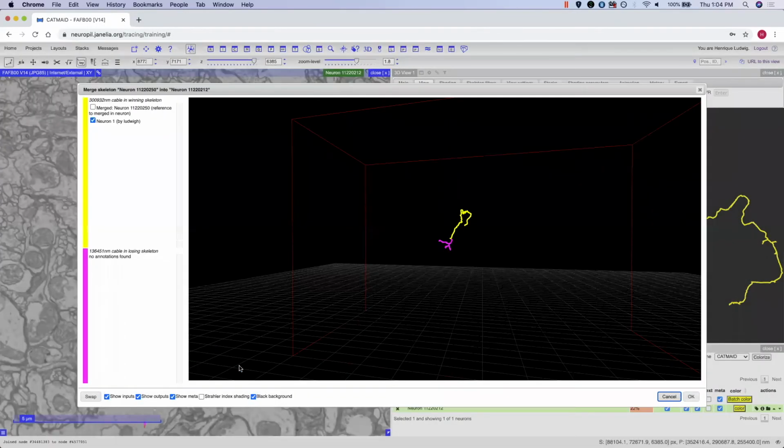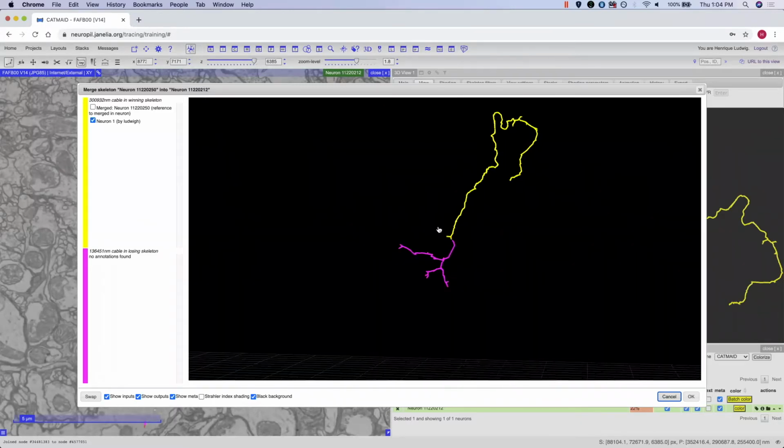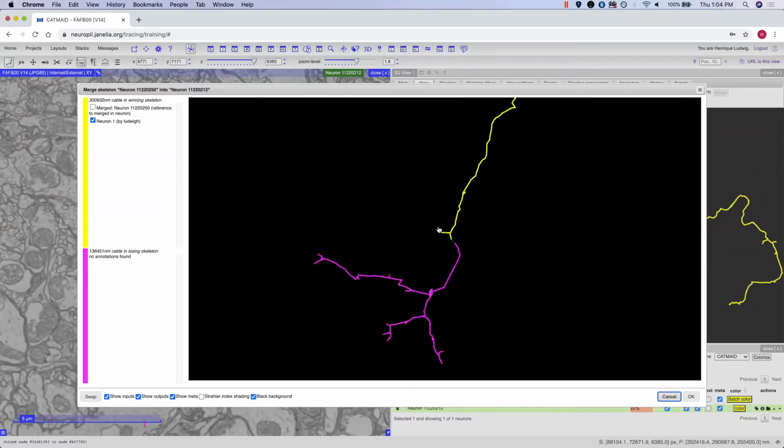A window will appear with the two skeletons that will be merged together. If the merge is correct, you can identify this by scrolling in and seeing that both of these skeletons are the ones that you want to merge. You can click OK and move forward with the merge. Also be sure to maintain any of the annotations that were placed by the other person on their skeleton.